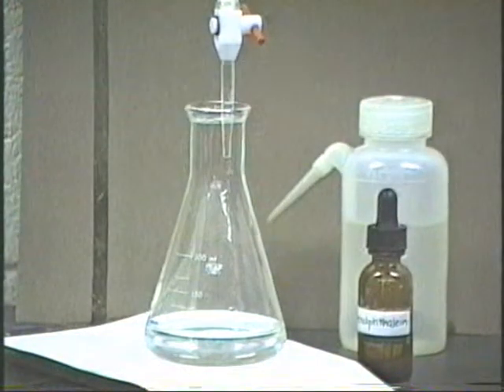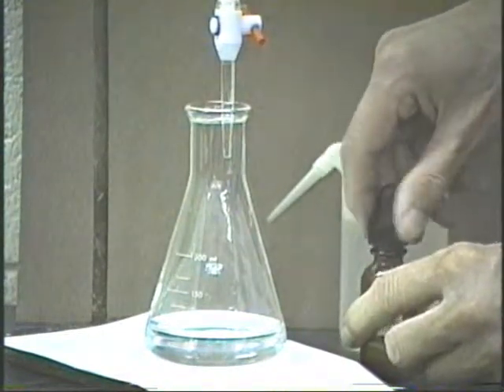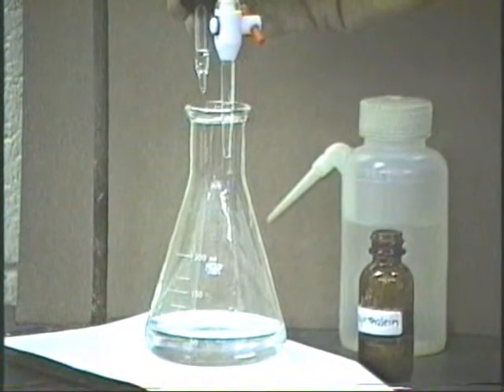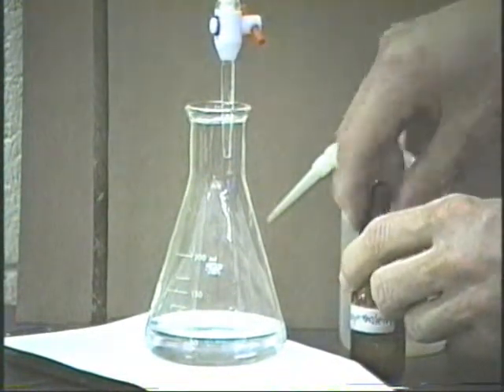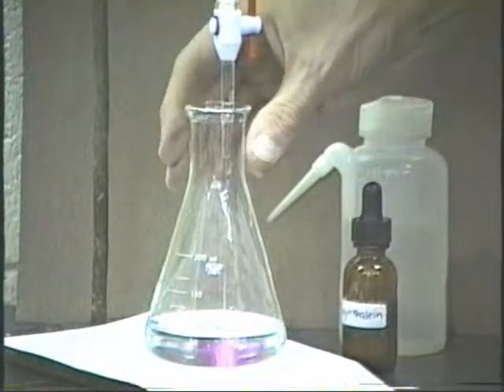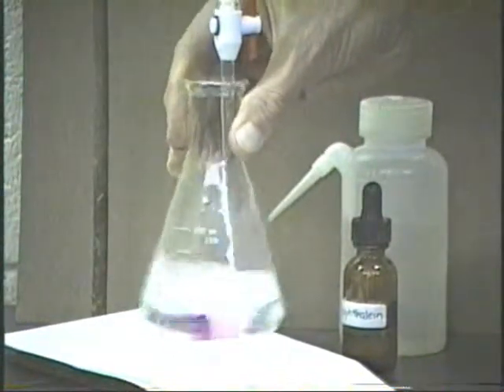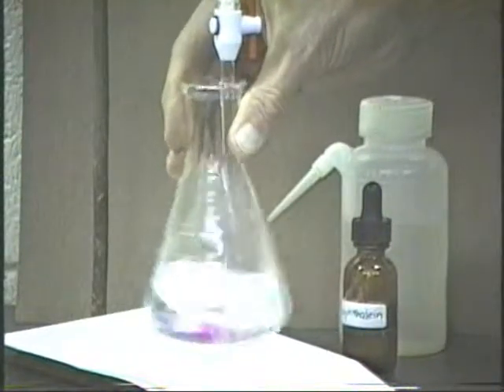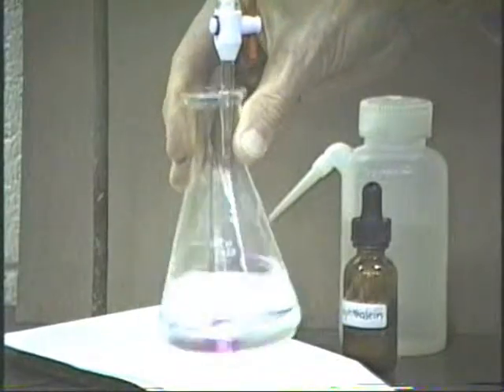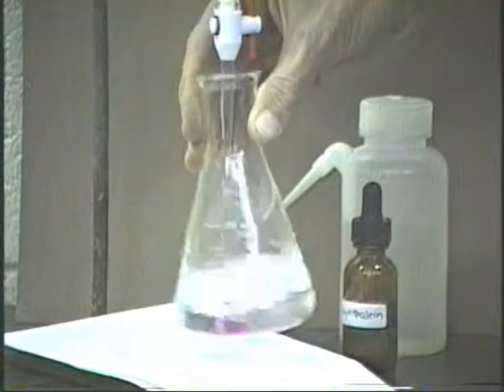Well, we're all set to titrate our vinegar sample. We read the initial volume of the burette, and we'll put in a couple of drops of indicator here. 1, 2, 3, and now we're all set to go. Now we can initially put in our sodium hydroxide fairly rapidly. We should keep swirling though. As you can see, there's only a small spot in the middle here. But as we keep adding at this rapid rate, that spot is getting bigger. As this pink spot keeps getting bigger.